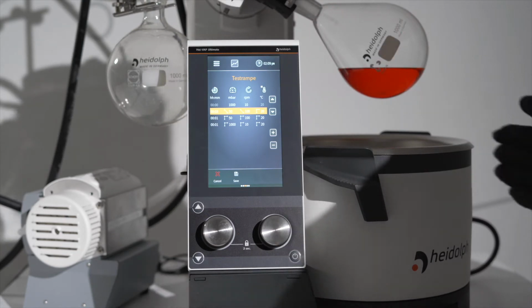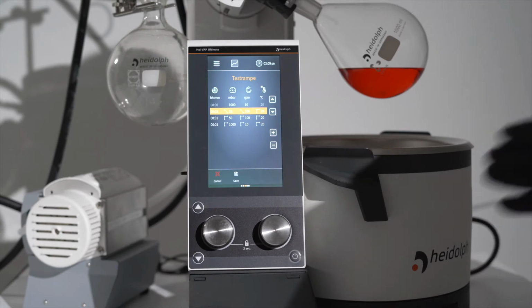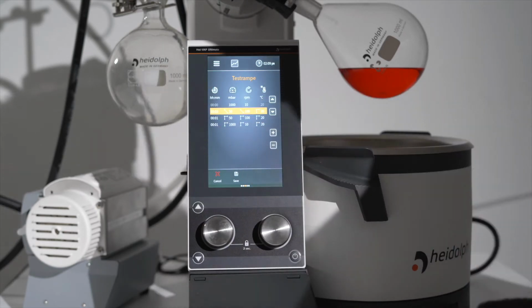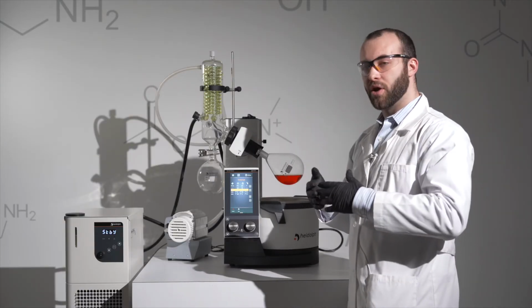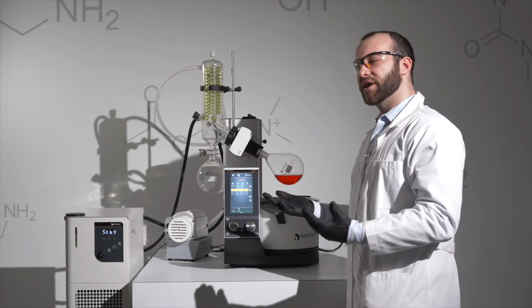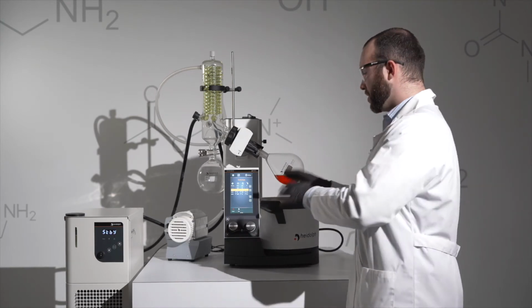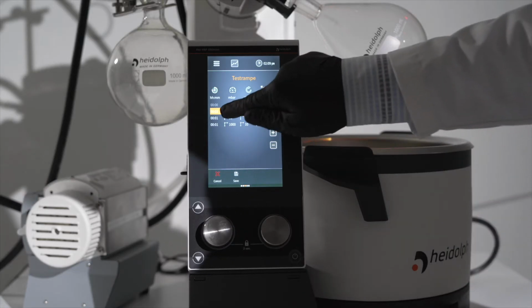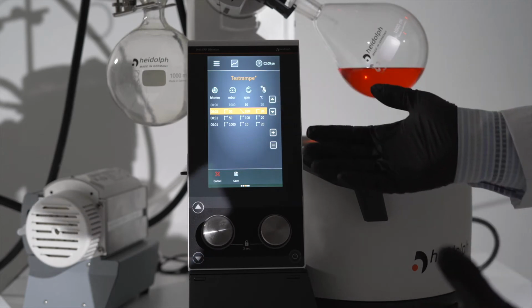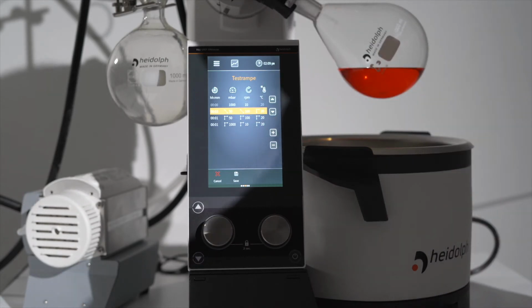Once you have selected that, you can then begin choosing what your ramping profile is. Ramping allows you to have different set vacuum, rotation, and bath temperatures at different periods of time during your process. So if you need to pull down to a certain vacuum to evaporate off one solvent, and then later pull down further to evaporate another solvent, you can adjust these using ramping profiles. You also have the option to choose whether or not you want it to happen as fast as possible or in a more linear fashion to prevent things such as bumping.